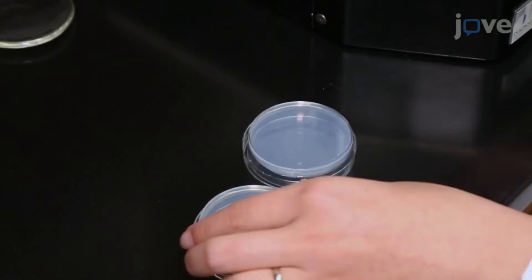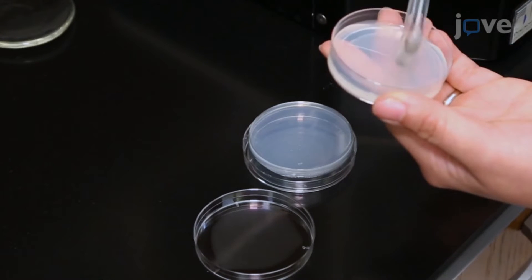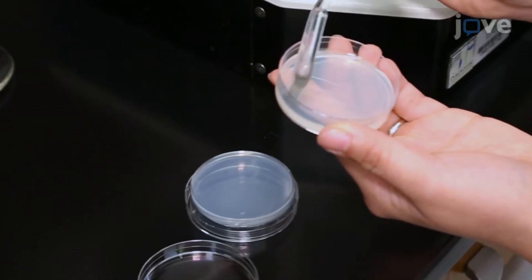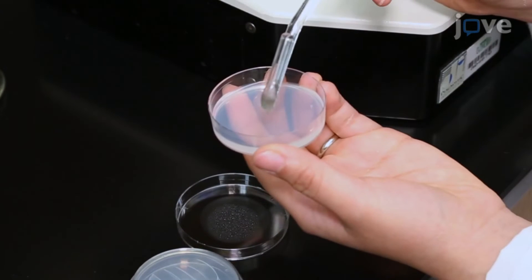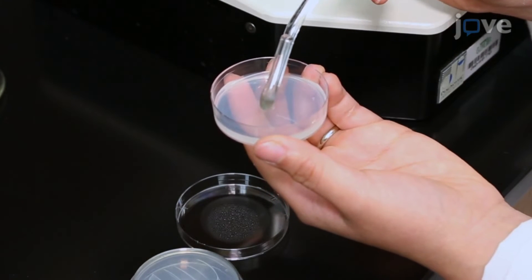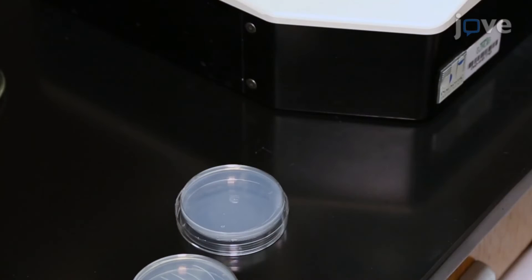Next, make a male staining plate. Use the end of a glass stirring rod to scrape E. coli from the bacterial lawn of a seeded plate and deposit it onto the center of an unseeded NGM plate, making a 5 to 7 mm diameter food dot.